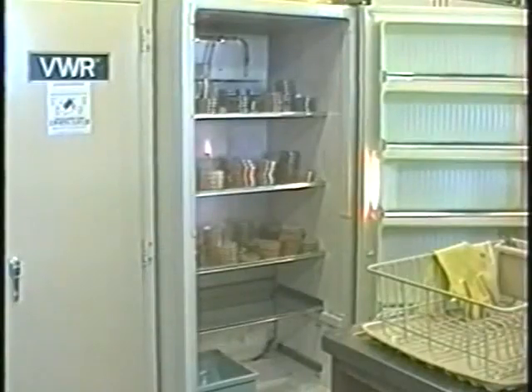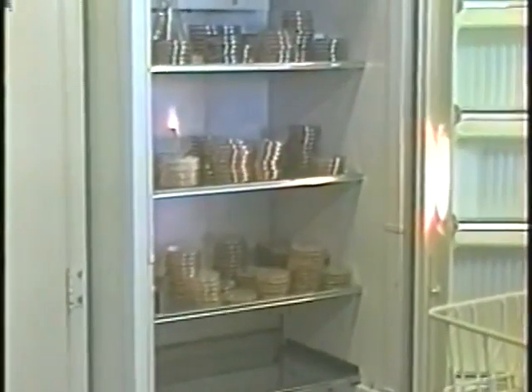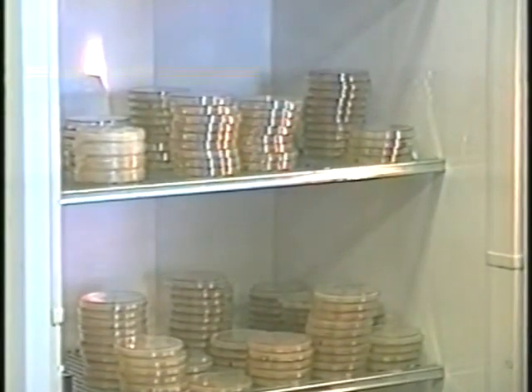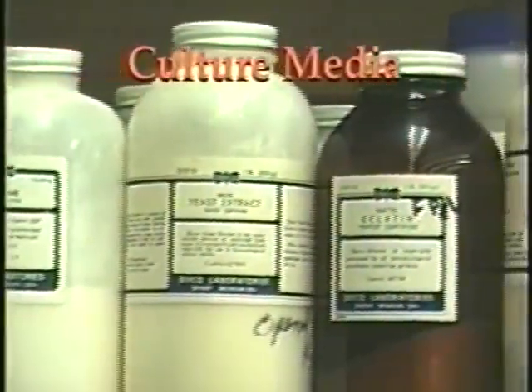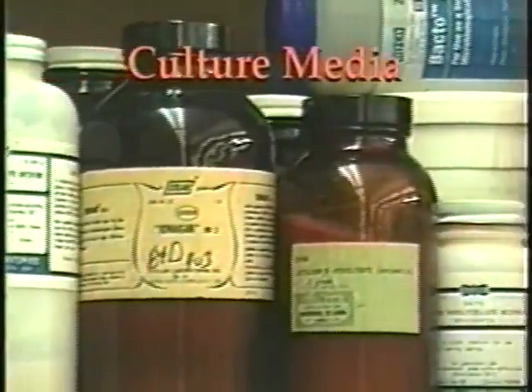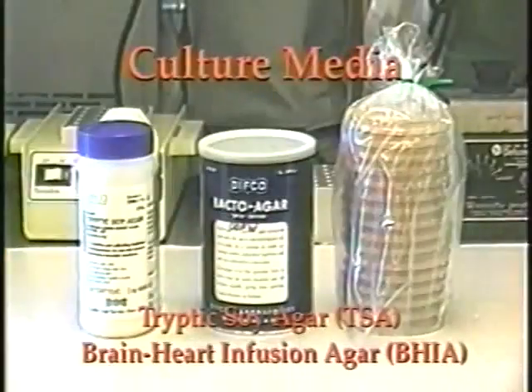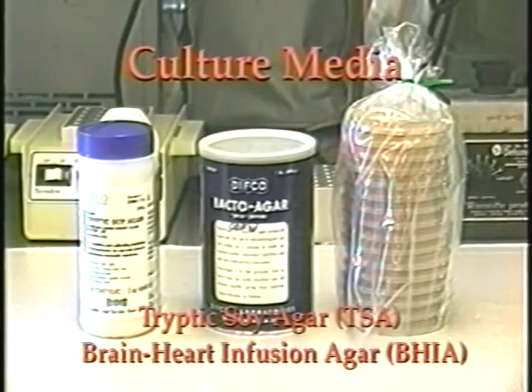An 18-degree incubator is helpful, but a clean bench top in a room with a stable temperature of 18 to 22 degrees will suffice for growing most bacteria. The first consideration in culturing bacteria is the choice of media. Some bacteria are very fastidious and require special nutrients. However, tryptic soy agar and brain-heart infusion agar are commonly used for routine isolation as they support the growth of most commonly encountered salmonid pathogens.